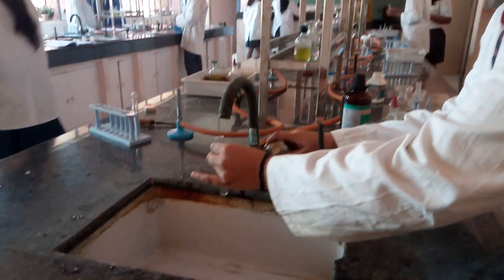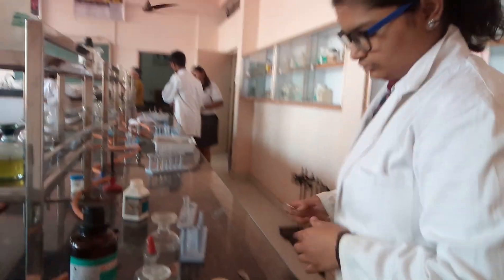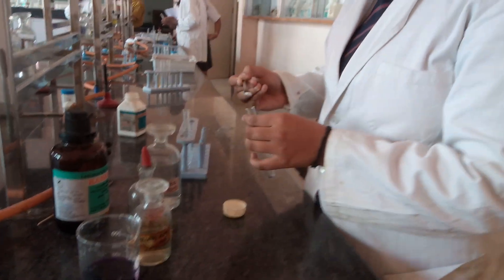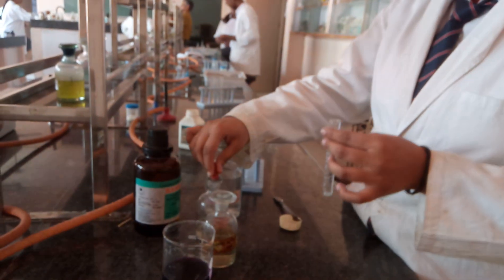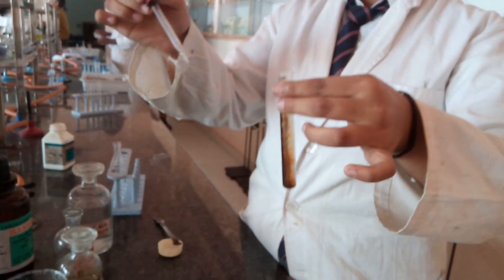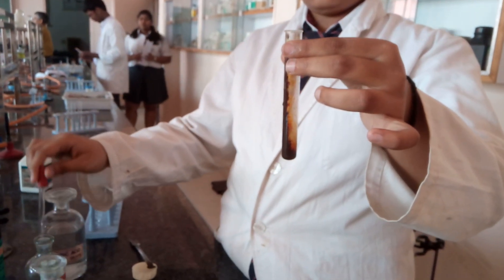Now she will be taking a fresh sample of salt to move ahead in the anion testing. To the fresh sample, she will now be adding concentrated sulfuric acid with a dropper, because it is a corrosive acid. Please pay attention and observe while the acid is added.